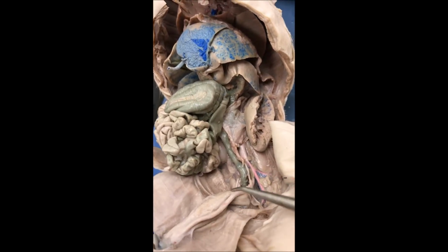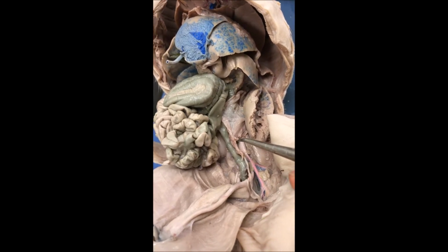There's the umbilical artery next to it. This is the dorsal aorta, and right next to it underneath there is the vena cava. And then these branches down here into the hip area, we have common iliac, deep iliac circumflex, external iliac, and internal iliac, which is underneath. Then it becomes the femoral and the deep femoral.